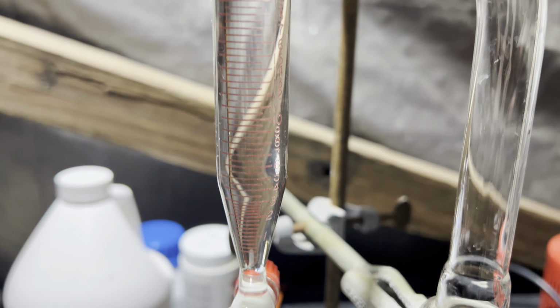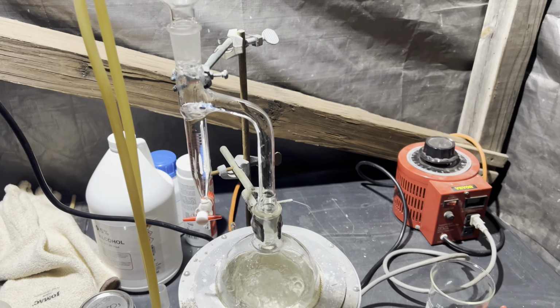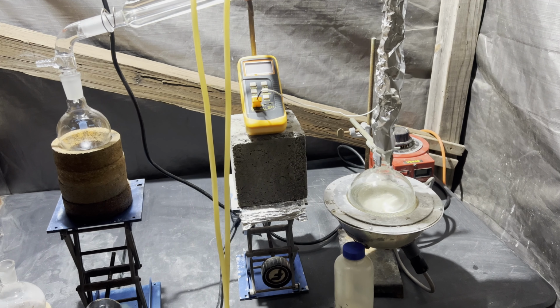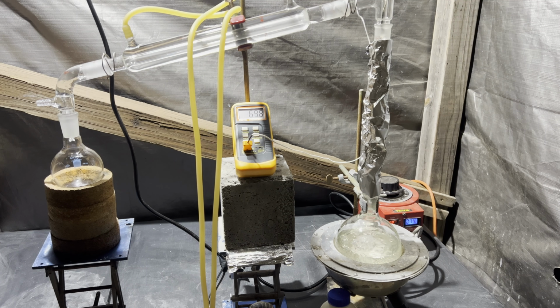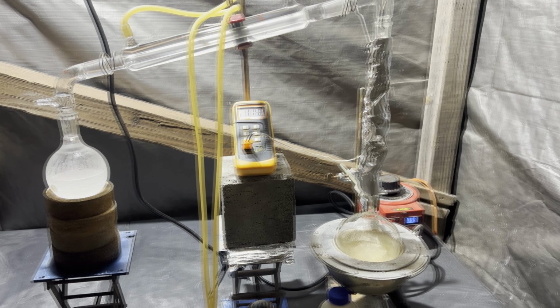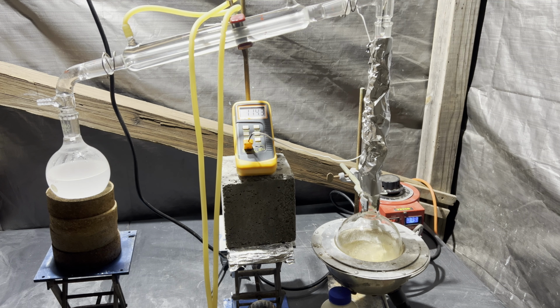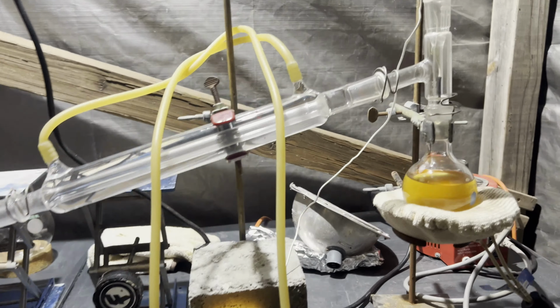I ended up doing it 7 times, that is, filling the round bottom flask and returning it to the flask. And after that, I moved on to fractionally distill off the ethanol and the toluene. Once the boiling point reached about 110, 115 degrees, I want to say, I cut the heat, waited for it to cool down, and then transferred it to a smaller flask just because it would be a better recovery. And I washed out the 1 liter beaker or flask with some of the distillate.